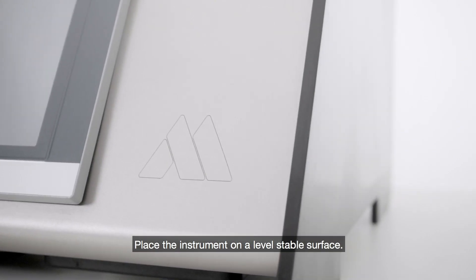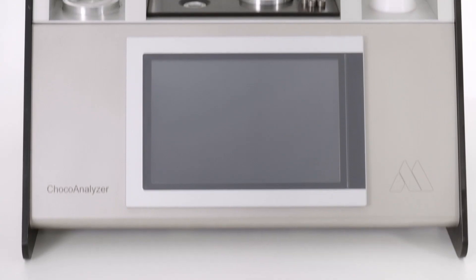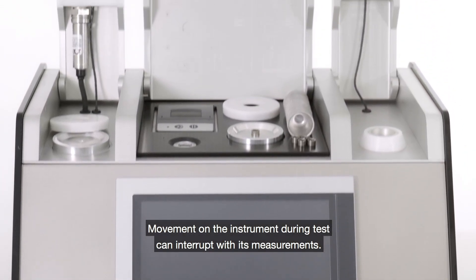Place the instrument on a level stable surface. Movement on the instrument during test can interfere with its measurements.